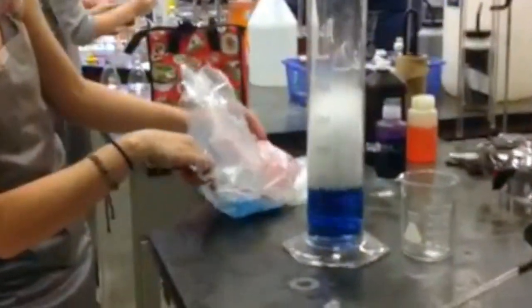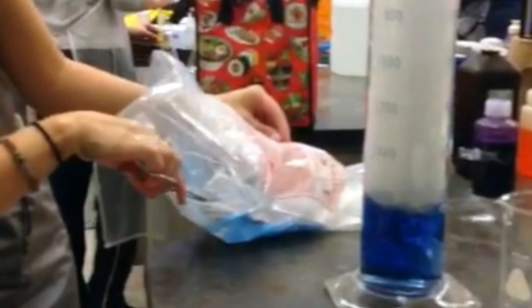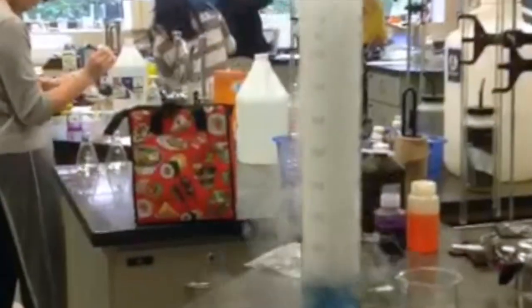As the CO2 bubbles, the white vapor is just water vapor. As it bubbles in the solution, it neutralizes the basic solution, which will change the color from the blue basic to a teal, showing that it's getting close to acidic, to a green, and then to the yellow. The color won't go very acidic, so more red, because carbonic acid is a weak acid. And now it has reached the yellow stage.